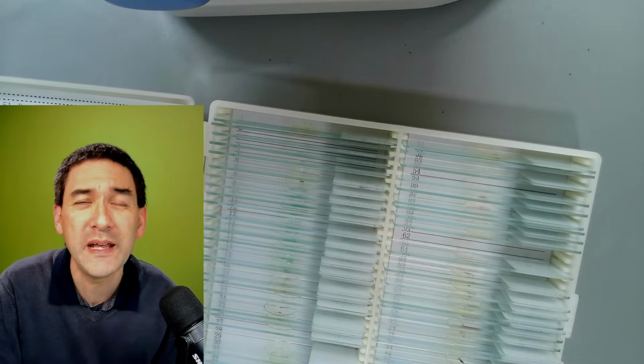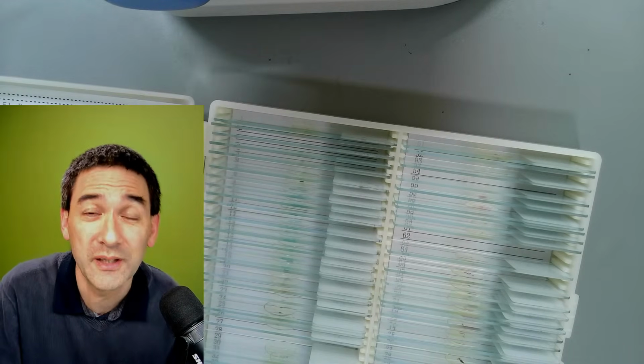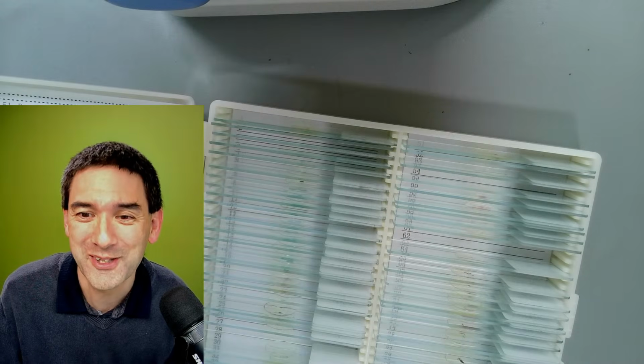So I had a lot of empty magnification. It was very suboptimal, but it kind of worked. And then I also used an analog surveillance camera. So in the past I've played around a lot, and I encourage you to also do that. And share your ideas, thoughts and pictures.